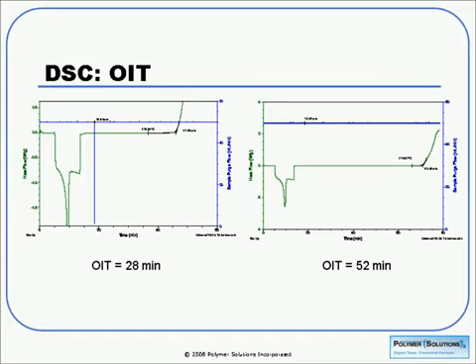PVC typically is not crystalline. It has just a TG. So this is information that tells us that perhaps this isn't really PVC, or that there's something else there as well. So you can see how we can use it to confirm composition in some cases.